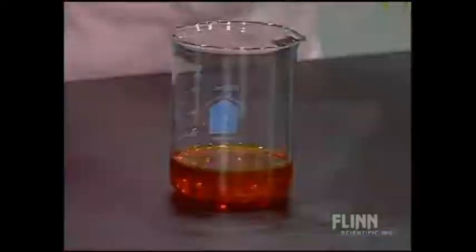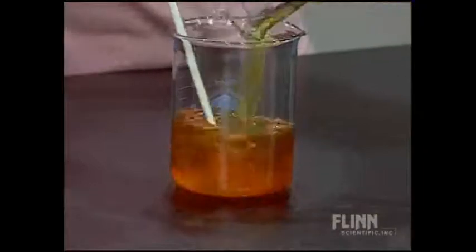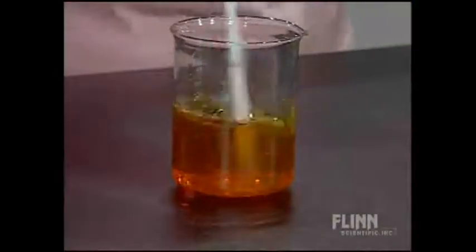I'm going to pour. Let's stir. If we can get the lights off — immediately, very good glow there, a bright yellow glow. That's the chemiluminescence. Let's stir it just a little bit more to see if that makes it last a little longer. It looks a lot like the glow-in-the-dark color that you see.